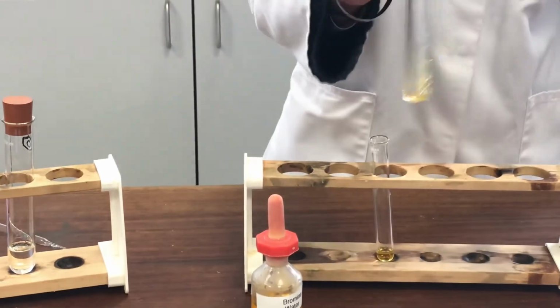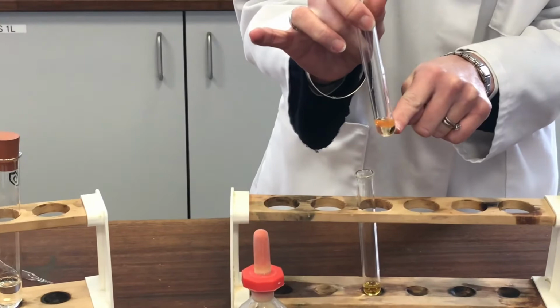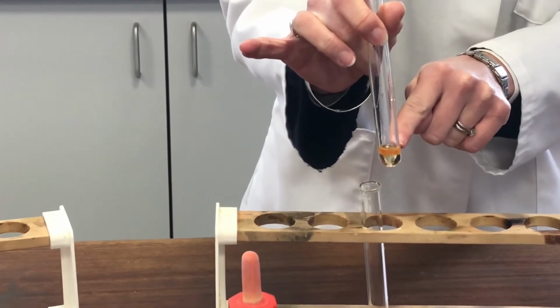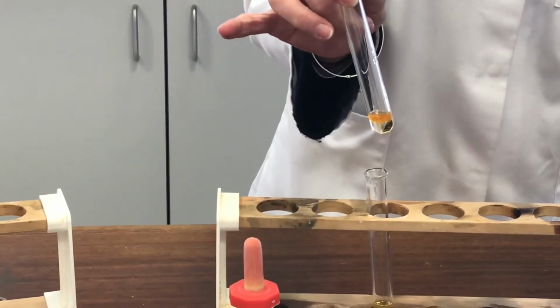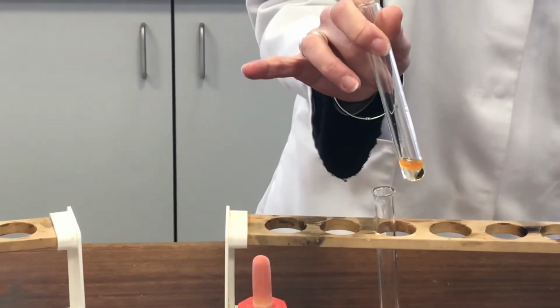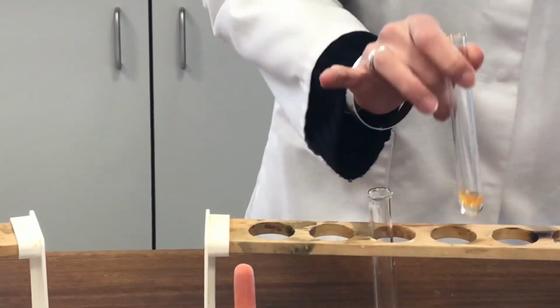In fact, there doesn't appear to have been a reaction, but you might notice that the bromine water has opted to dissolve in that organic layer, the benzene-based layer, but it doesn't appear to have reacted with it. So you can see the colours all concentrated in that top layer, but the colour's very definitely still there. That bromine is still there.